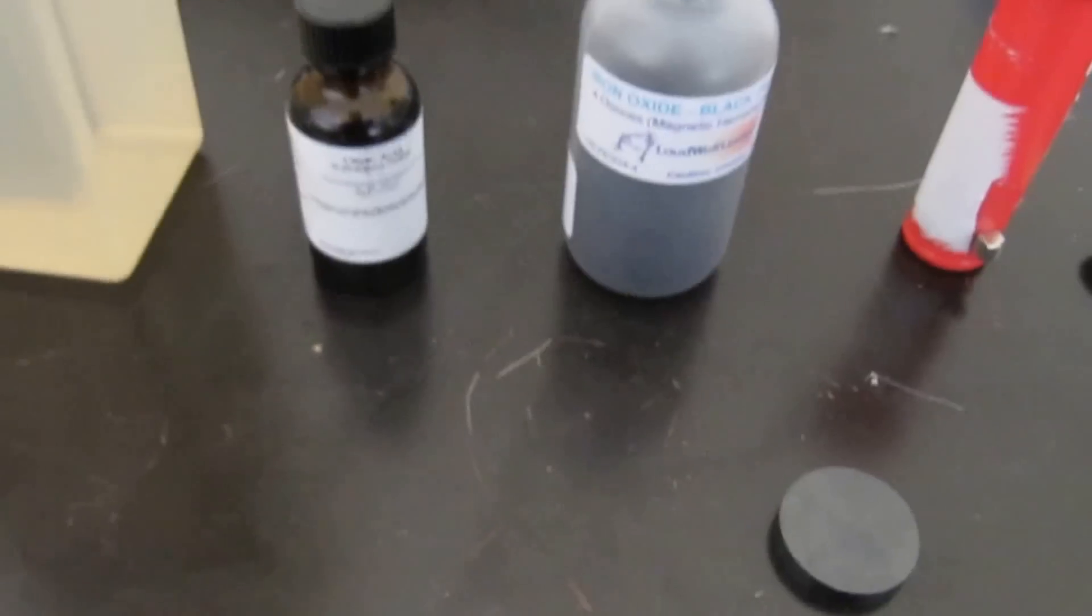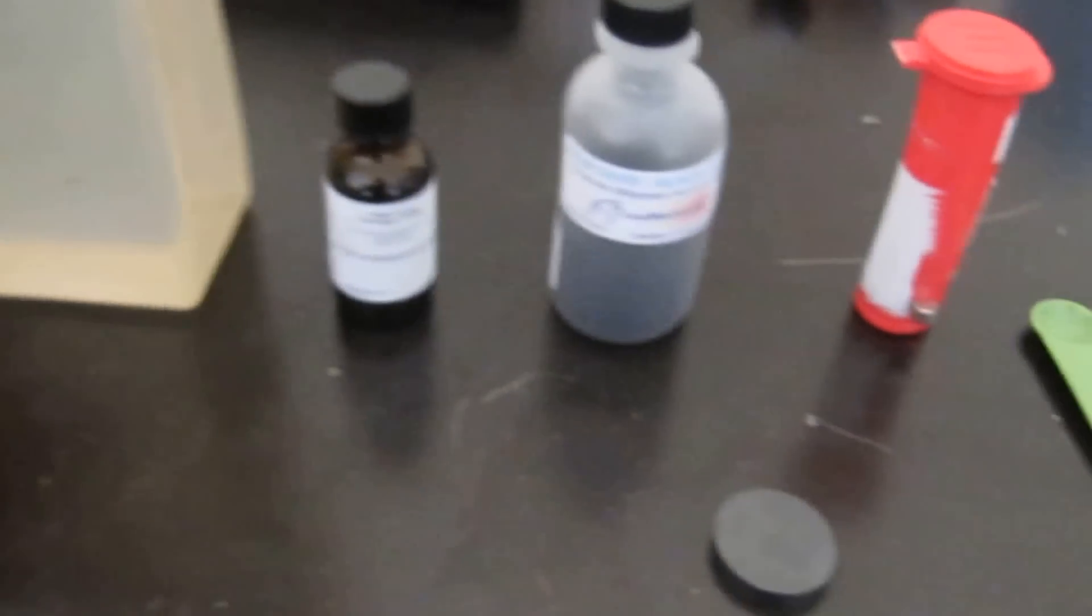Good morning and welcome to this channel. I wanted to show you today how to make ferrofluid. There's a number of ways to do this and I'll just go over this.